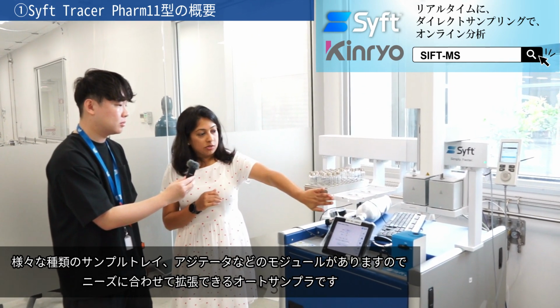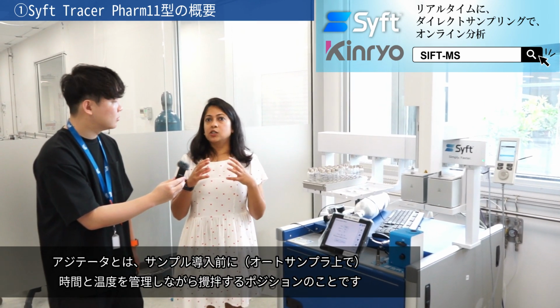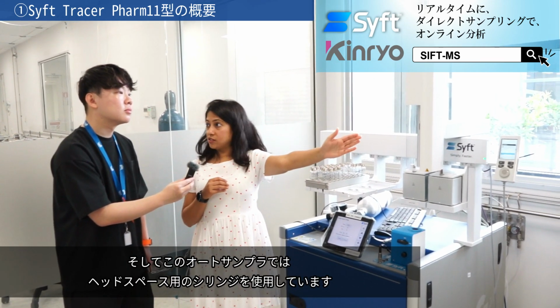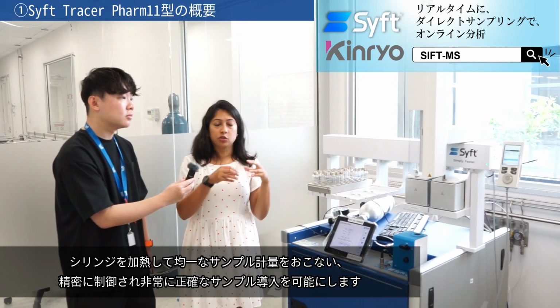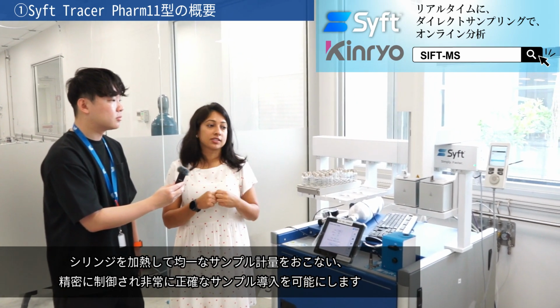It has different modules, so sample trays, agitator. The agitator is where you can have a time and temperature controlled sample incubation. We use headspace syringes, so it can heat the syringe, so that allows uniform sample delivery, very precise sample delivery, very controlled and precise.